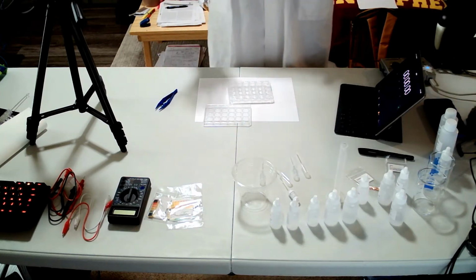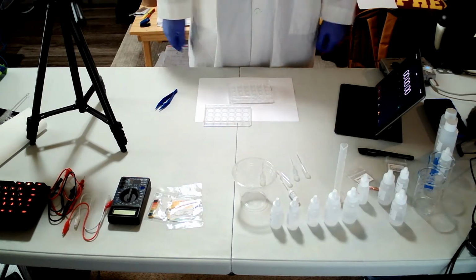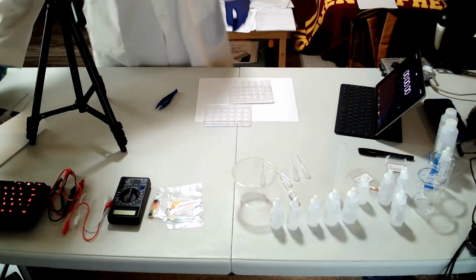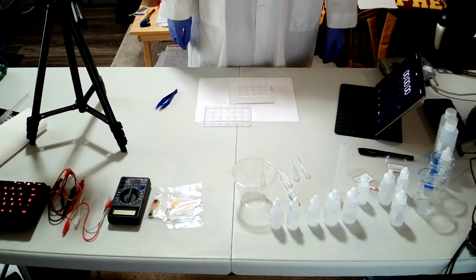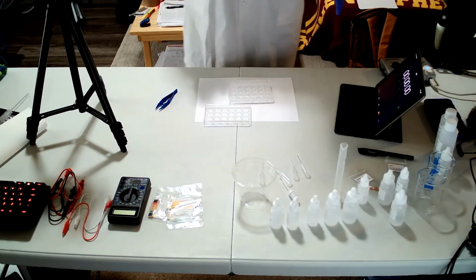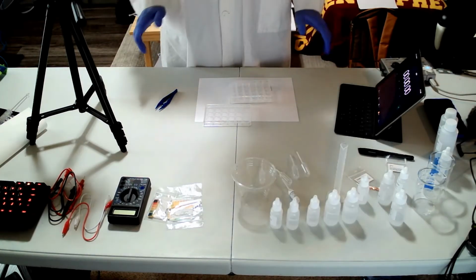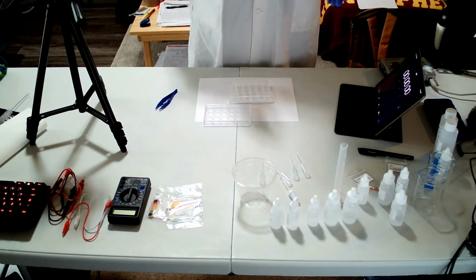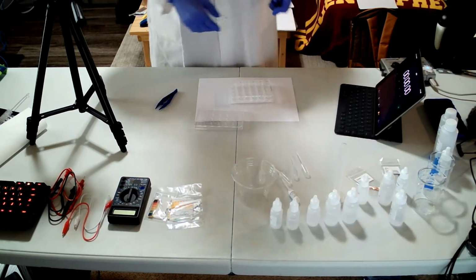So hi guys, I'm gonna briefly show you how those hands-on lab experiments work. I'm gonna start with the first one, the reaction order and rate laws. Since I'm using the leftover, it's not going to be step by step. I'm just going to show you what is going on in the procedure.